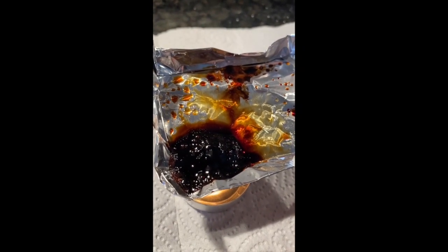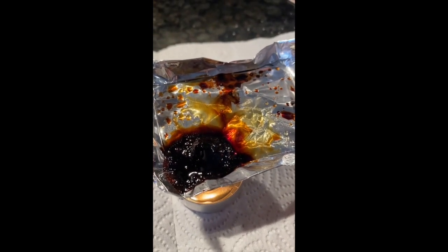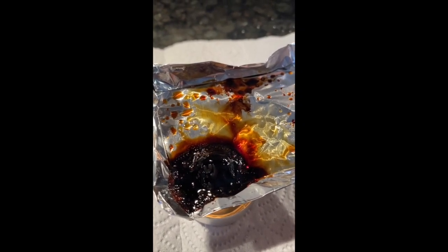It's definitely still got some liquid going on. It's still forming those air pockets and stuff. Or gas pockets, I should say, not technically air. We'll get into that a little bit later. It is actually making another bubble that we might see burst. But that is pretty much our final product here.